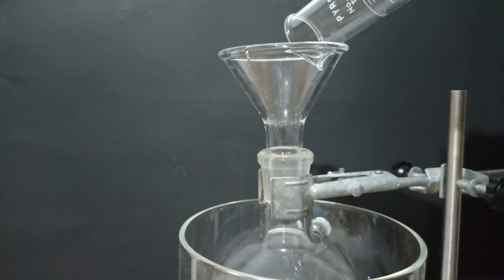Then we have to remove the methanol from the paracetamol, so I decided to distill it off. After 30 minutes, the methanol started coming out, and eventually I removed all the methanol. So there you go. We have here approximately 29 grams of paracetamol. I don't find it necessary to weigh it, because we are going to use it in another step anyway. So I immediately continued with the synthesis.